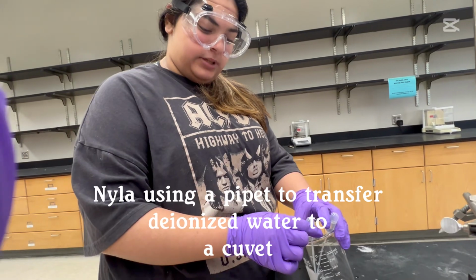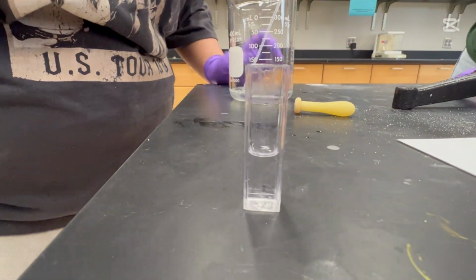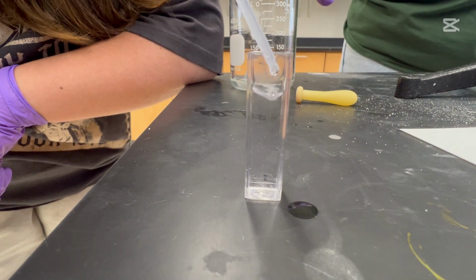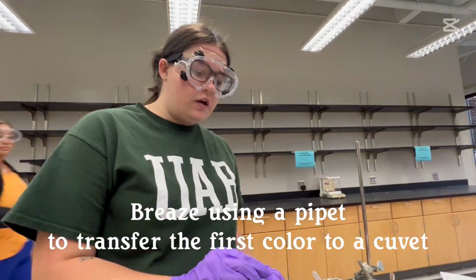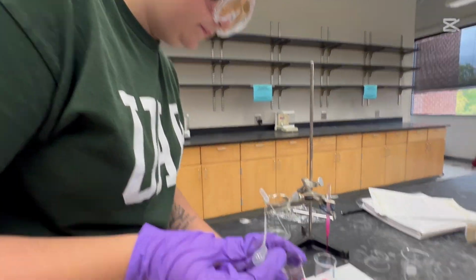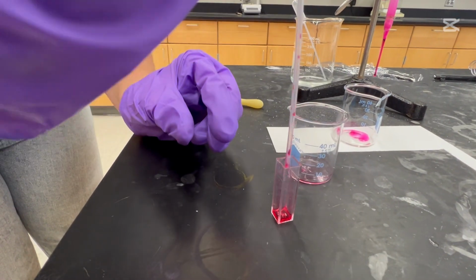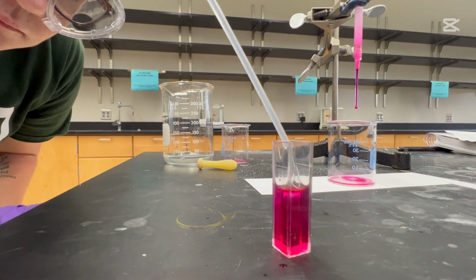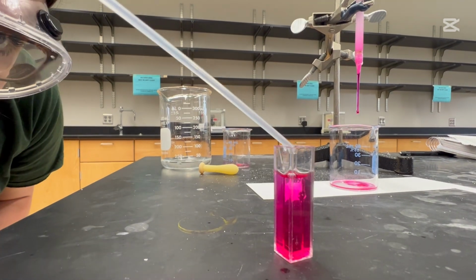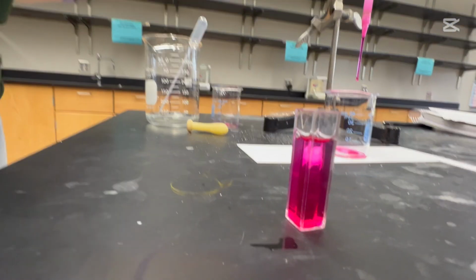Deionized water to fill our blank cuvette. And the meniscus is there. Make sure there are no air bubbles. Perfect.